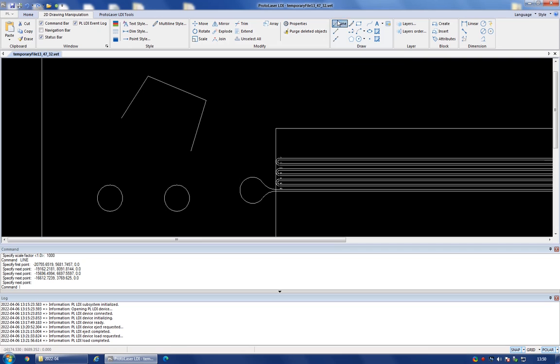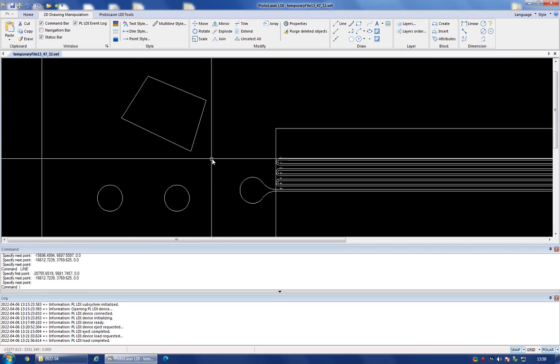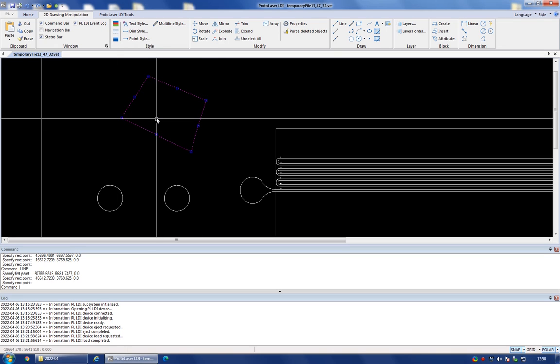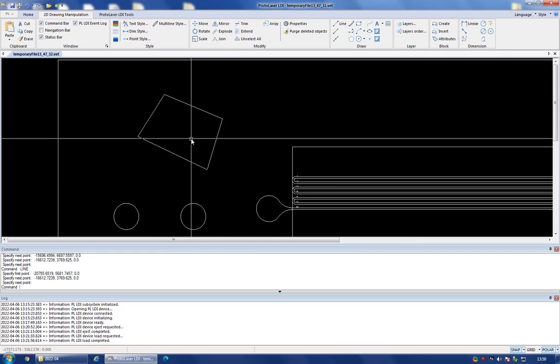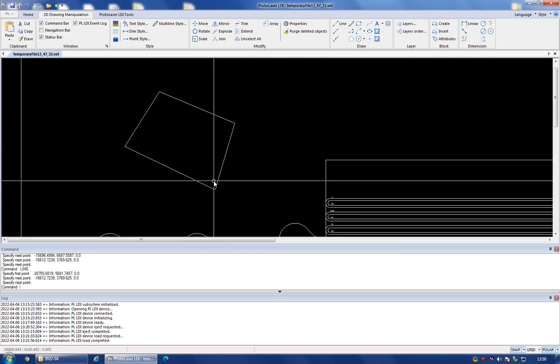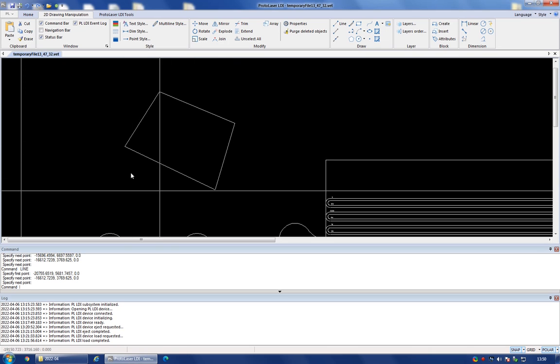If I close this shape, this will now be an enclosed shape, and I can use this whole selection as an area that will be exposed by the laser writer. So you see, we can use actually this rectangle here as an example. So if you want to assign a certain exposure to this rectangle and you want to expose this area, then what you want to do is select the whole thing.